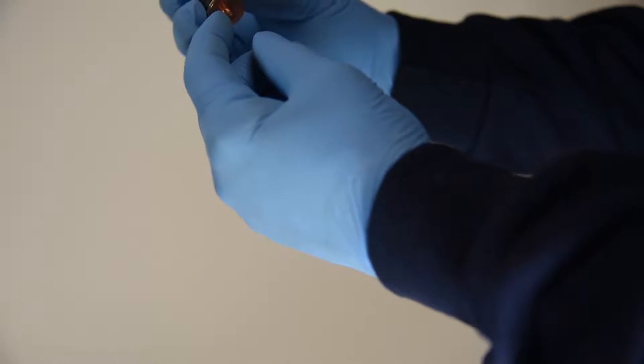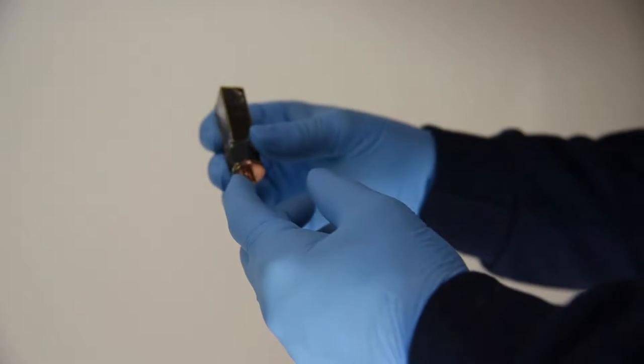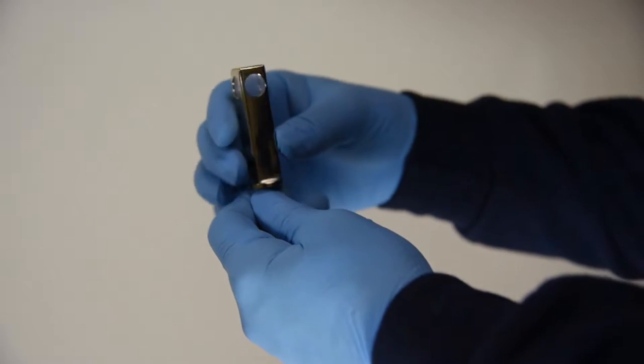And then it's actually screwed in. This is a 1.25 thread and you could use indium gasket, which we supply, and screw it into your cryostat.